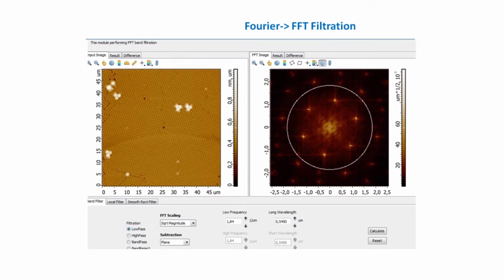And what do these spikes mean? These spikes mean that we have some periodicity in this or that direction. That's the first point. And the second point, how to read this Fourier image. The smallest frequencies are lying in the middle, and the farther the spike is from the center of the image, the higher the frequency.